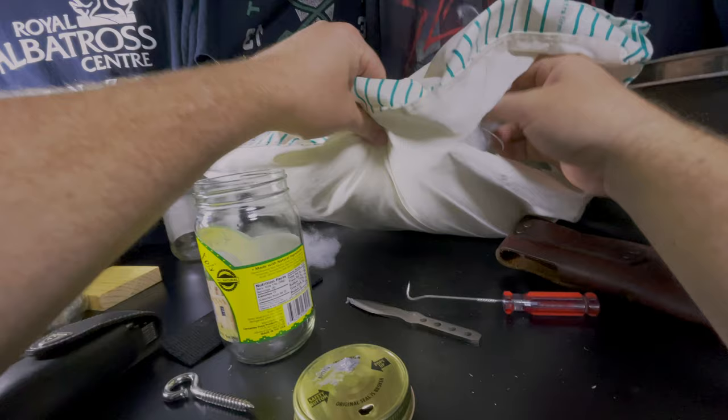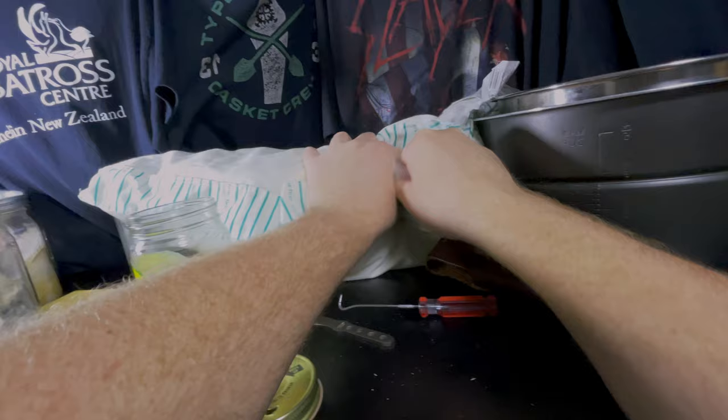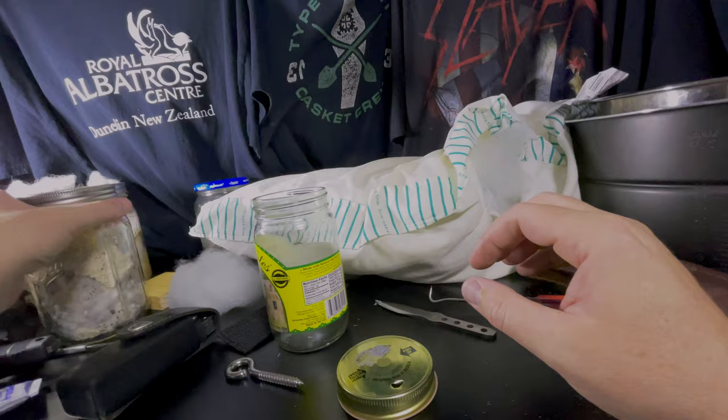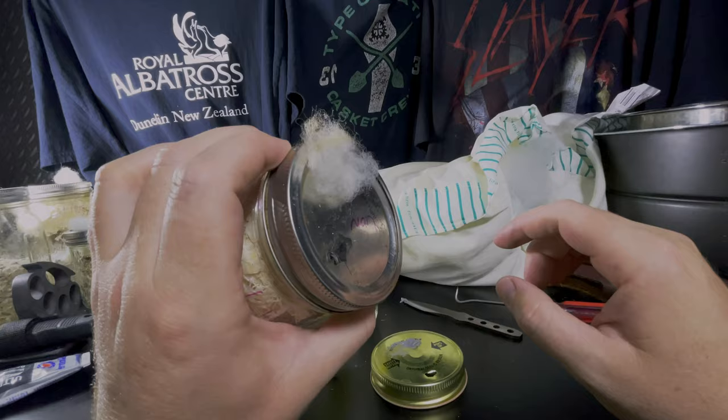You can kind of feel through it and you'll feel this kind of soft fiber, but that's not always the whole story. I've opened up some and it's more like a memory foam blend or something, and that stuff will probably melt, so you don't want to use that. This stuff seems to be much higher temperature. I don't think I've changed these on these jars, and I've run them through the pressure cooker, I'd say at least 6-7 times probably since I made those.